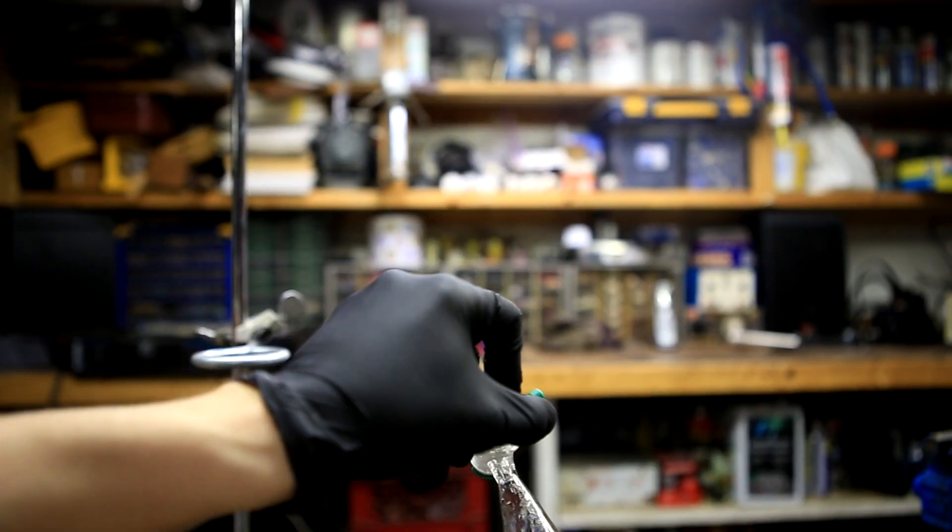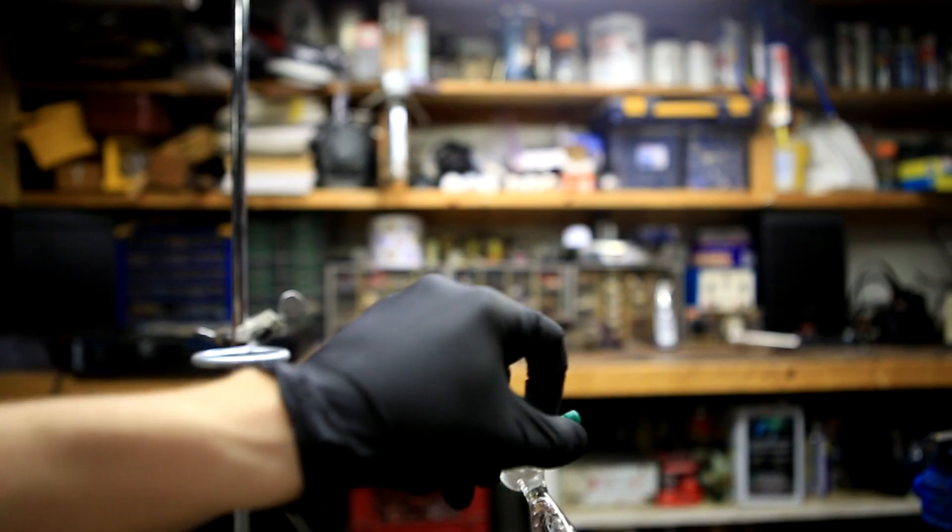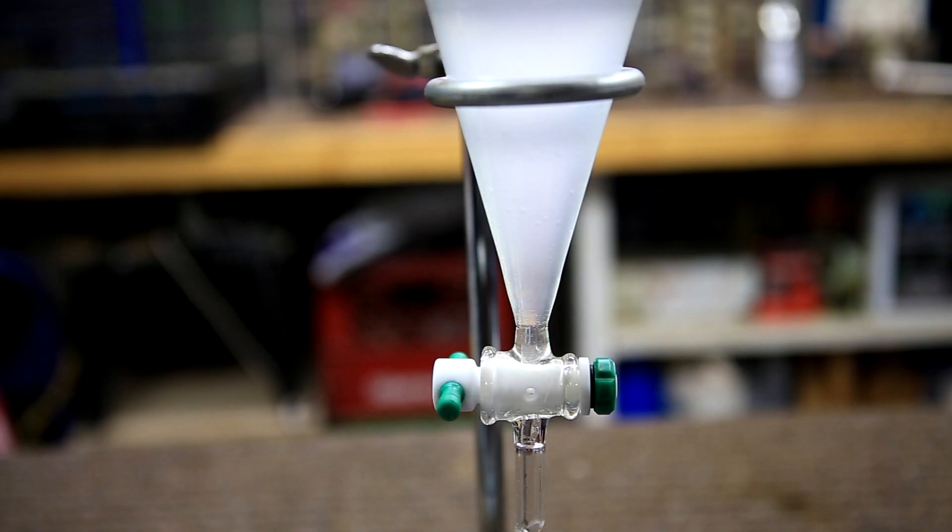If you shake the mixture too vigorously, you might end up with an emulsion which is undesirable. If you do make an emulsion, you'll get a white liquid like this and it isn't really a problem though.